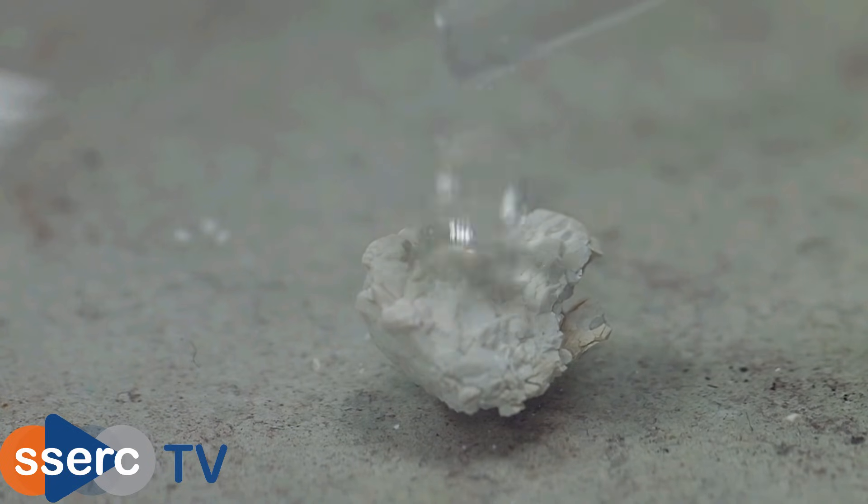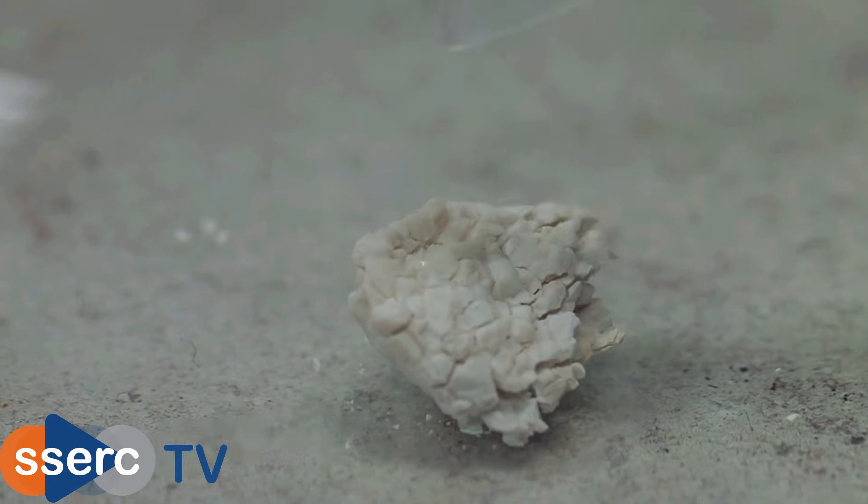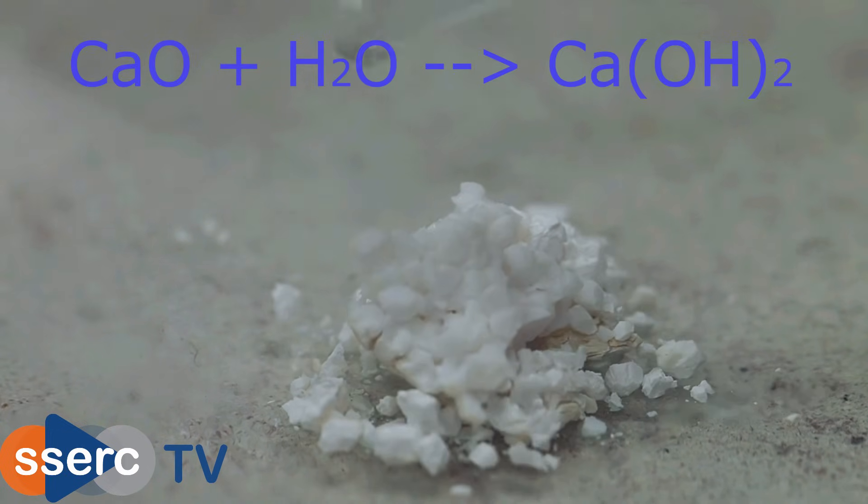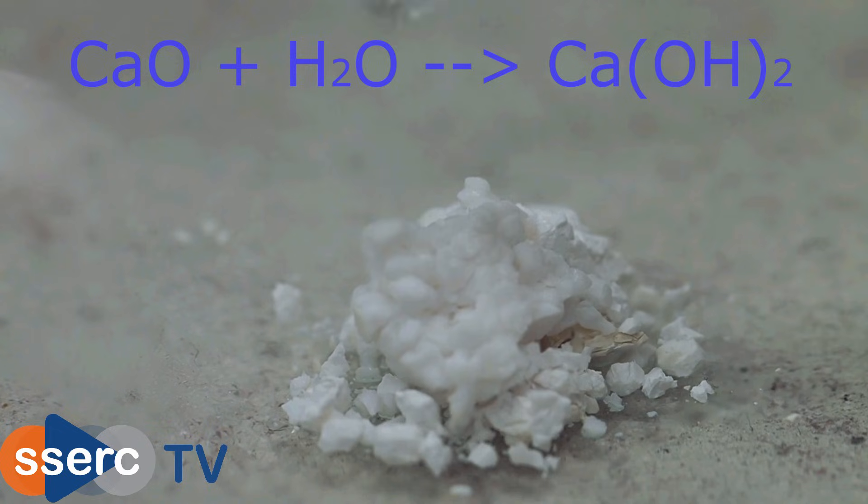Now we'll add a few drops of water to it. You can see it rapidly swells and you can see water vapour coming off as the hydration reaction is very exothermic.